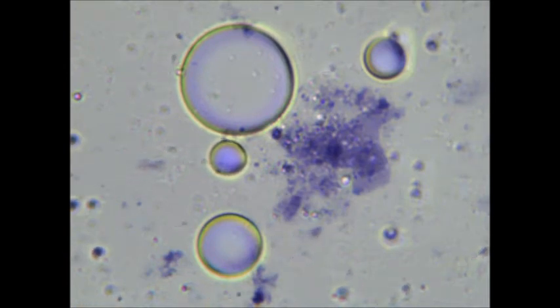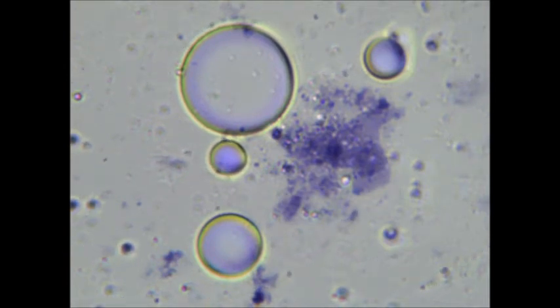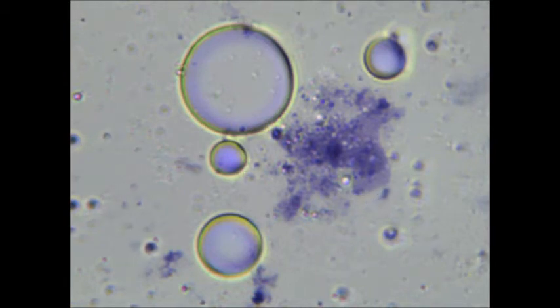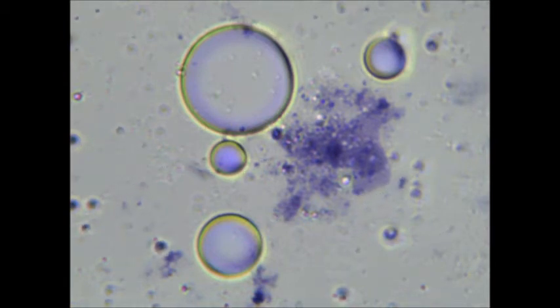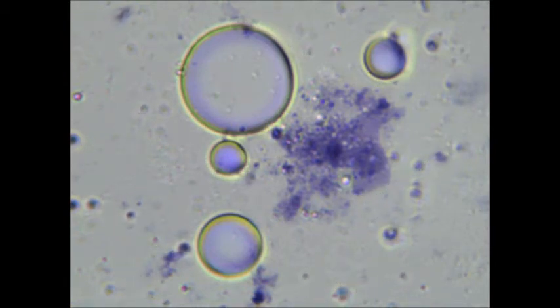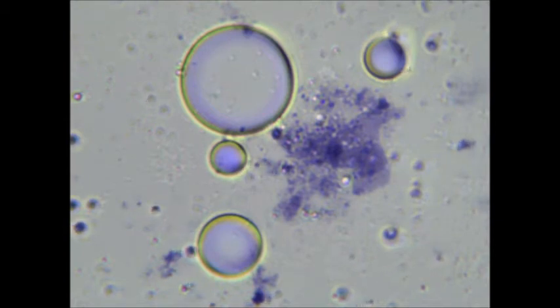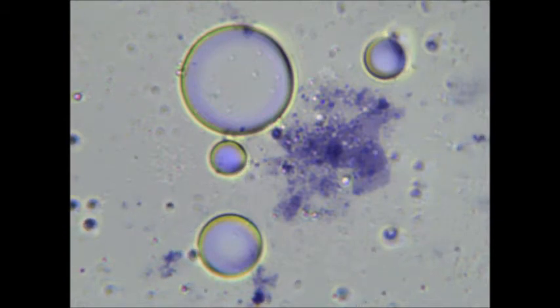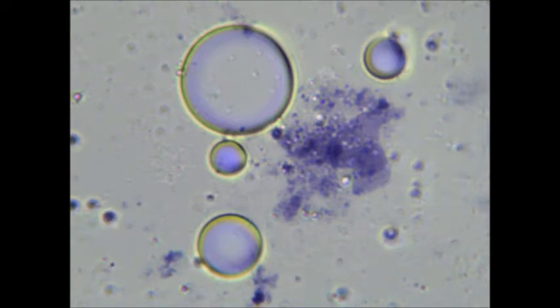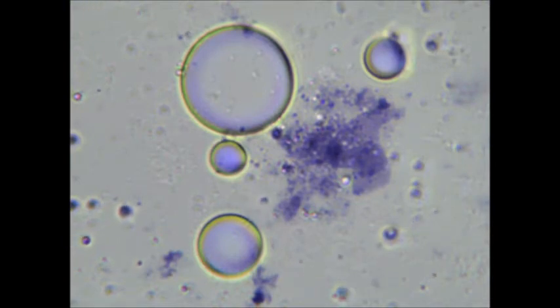However, I have come to realize that there really isn't a way for me to determine either way if this has actually happened. With this video, you can see that the hematoxylin stain seems like it has aggregated inside the vesicles.